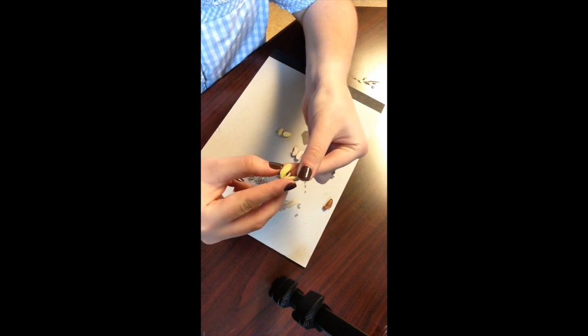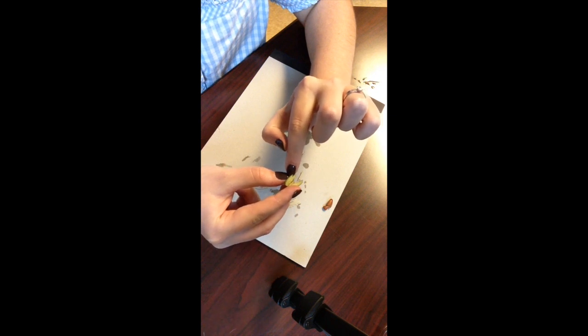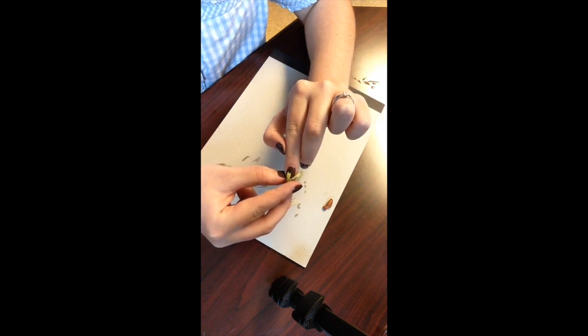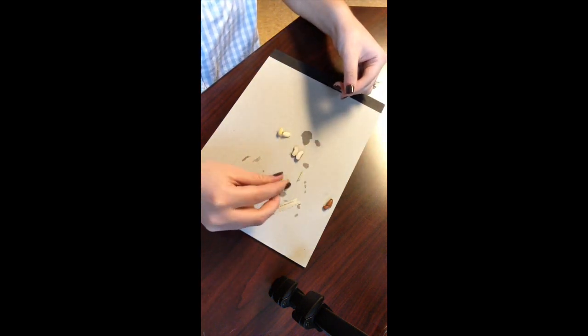What you see here are two cotyledons and the first two true leaves. And so I'm going to separate that. What's on my fingernail are those leaves that are going to emerge, and the cotyledons is basically what was in the seed.